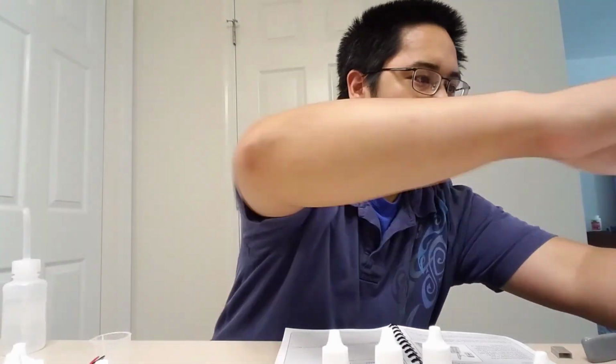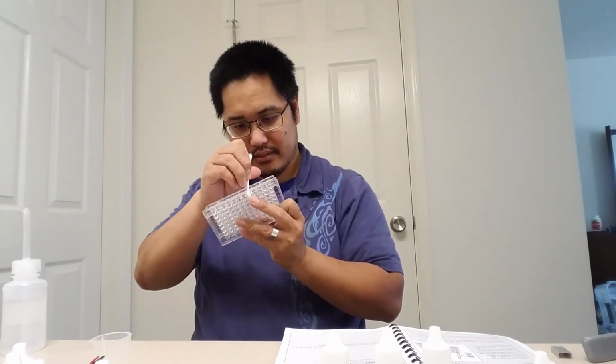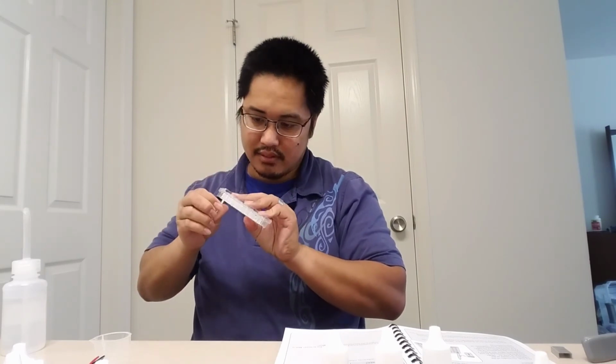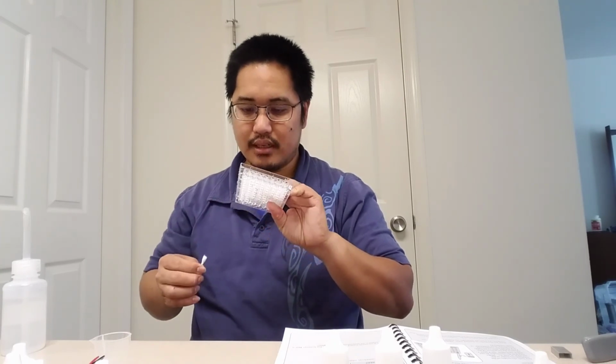Okay, I think some of that glycerin is stuck inside one of my wells, and I don't want it to get stuck there. So I'm going to take this Q-tip and swab it out. There we go. If you don't clean this stuff out immediately, sometimes it will just start drying in there, and then it's going to be a pain to get out later. So, anyway, let's throw that away. That's that lab.